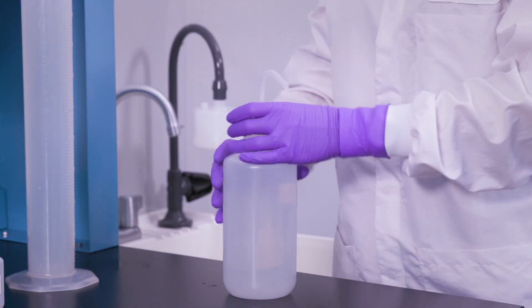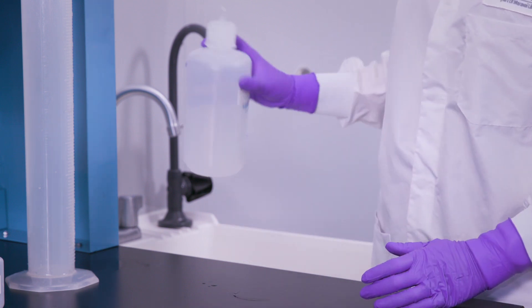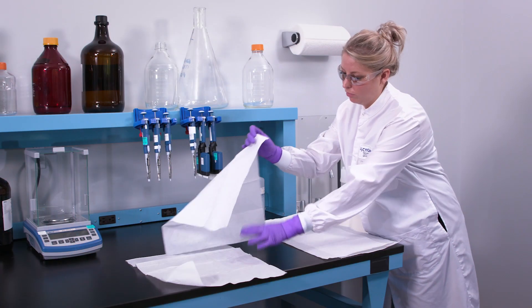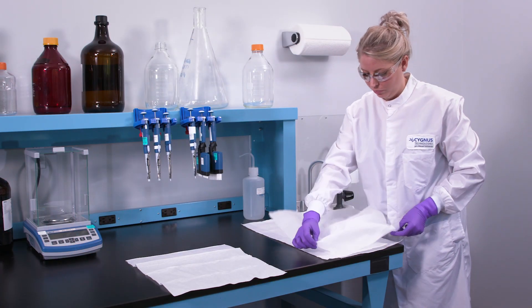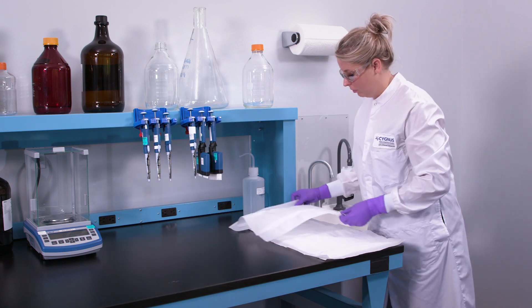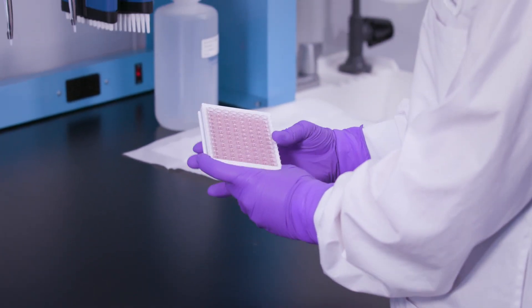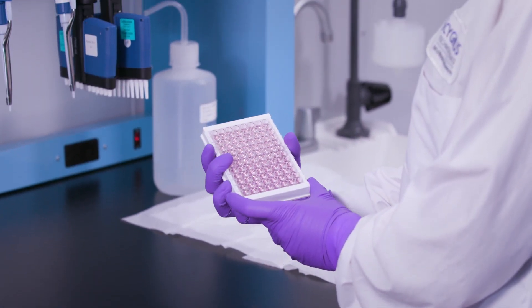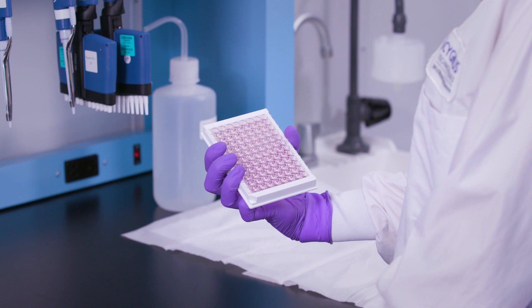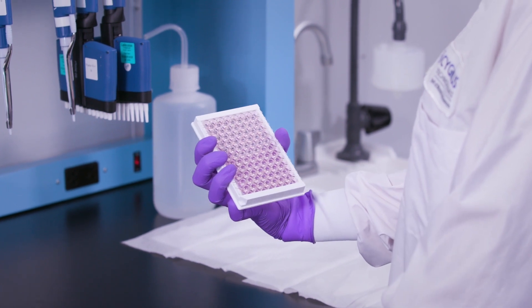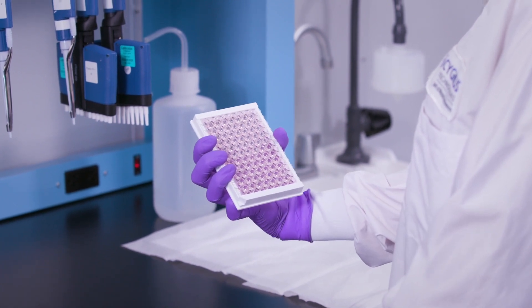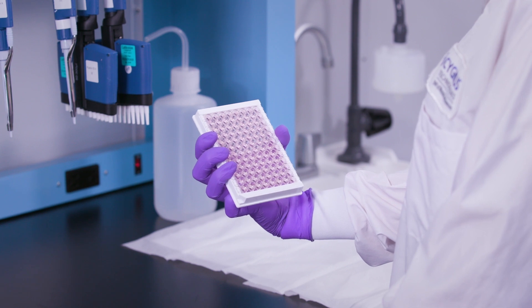Now that you've finished your preparation, let's demonstrate how to dump the liquid reactants from the plate. It's best to do this over a large sink, as it can be somewhat messy. First, grab the plate from the bottom with your thumb in the middle of one side and your fingers on the other side. If your thumbs and fingers slightly overlap the tabs on the ends of the strips, you should be able to prevent them from falling out of the strip holder.